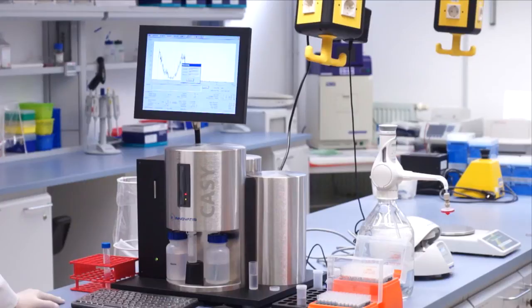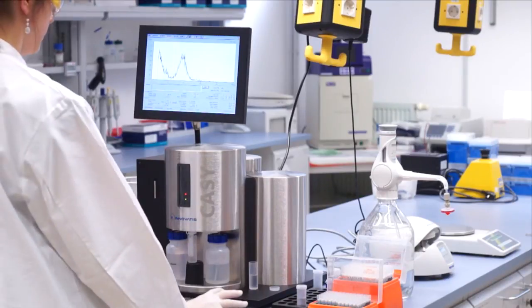After the last measurement, the final result is displayed, including the standard deviation.